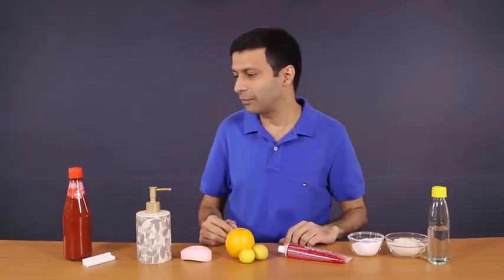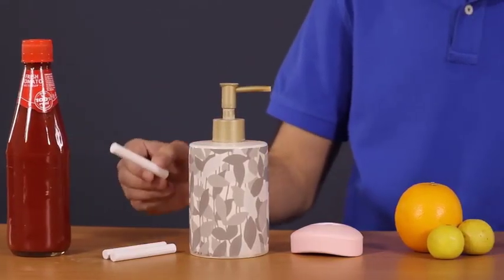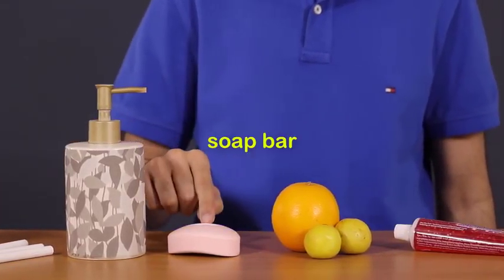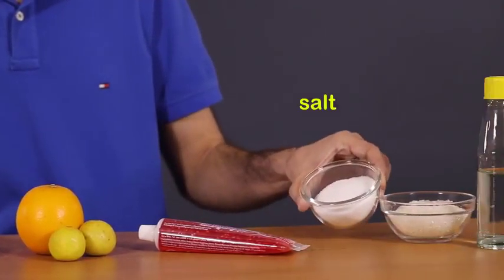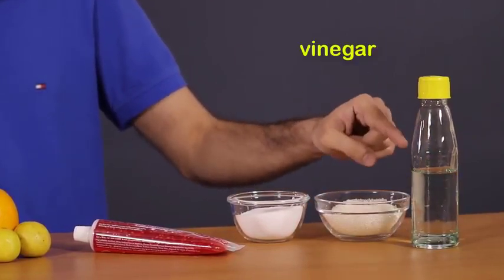So let's see, what do we have here. Here we have some tomato sauce. These are pieces of chalk, liquid soap, soap bar, orange, lemon, toothpaste, salt, sugar, and some vinegar.